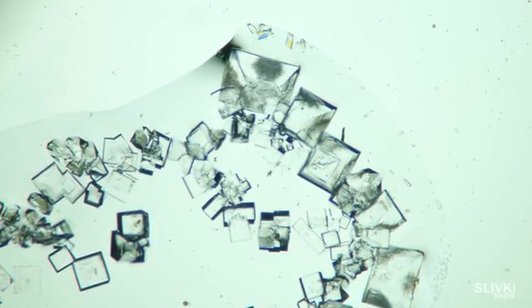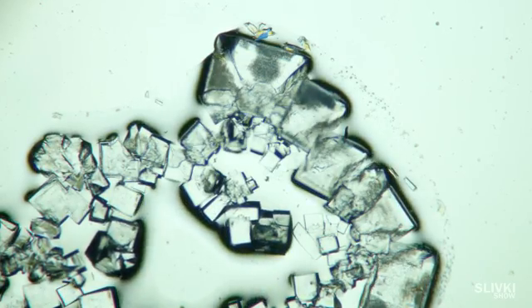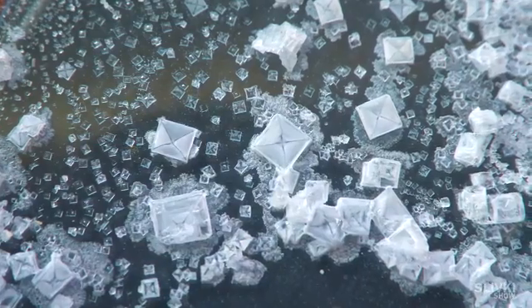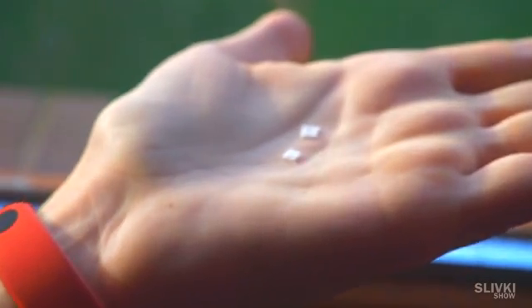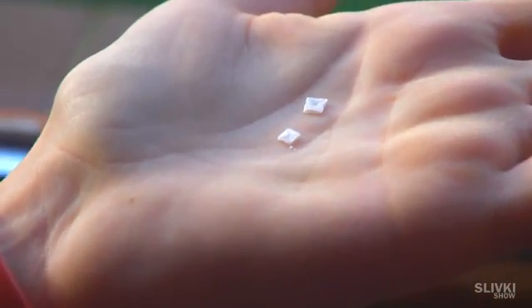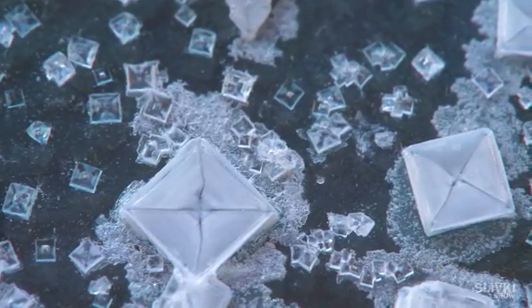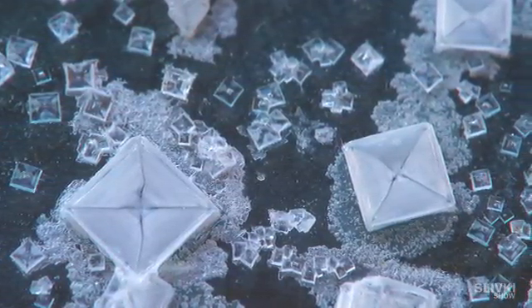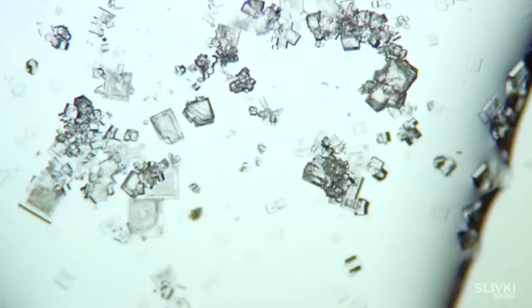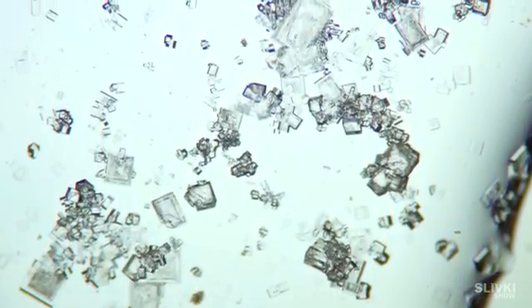Right now in fast playback — in fact the process took more than half an hour. As a result, crystals grow to quite large sizes. Some of them can be simply huge in relation to ordinary salt crystals, and remind you of small paper envelopes. You can do such an experiment and see results even without having a microscope.